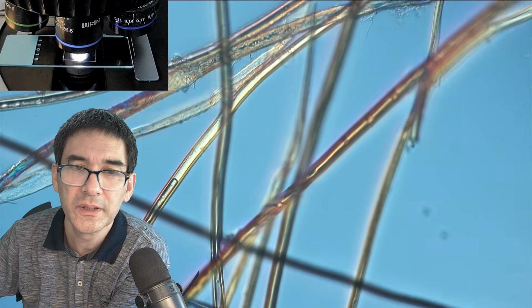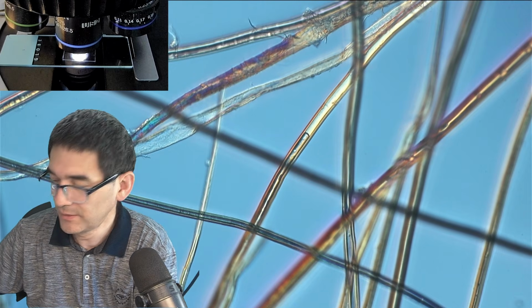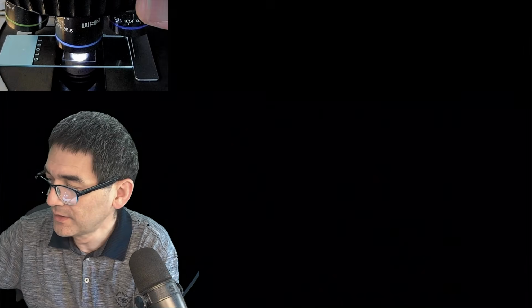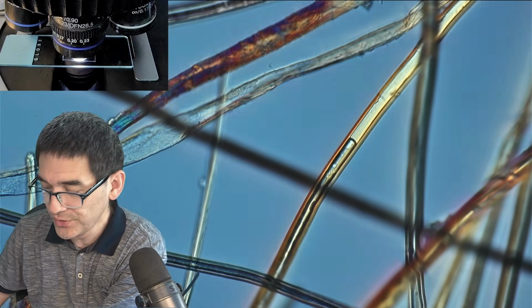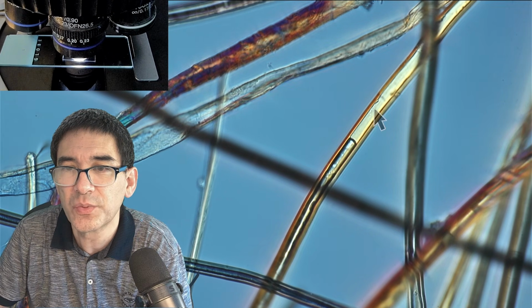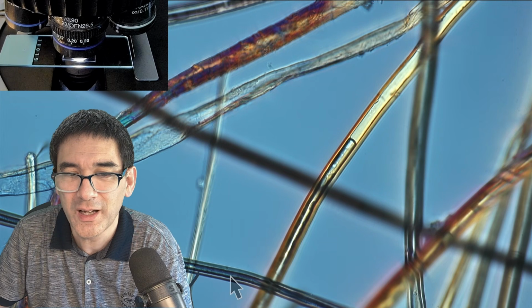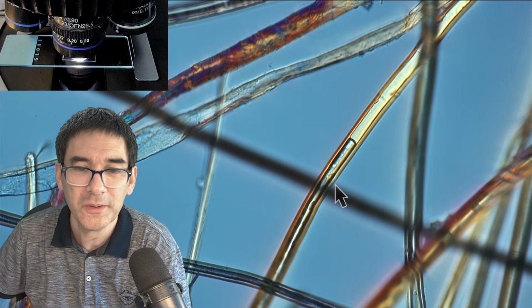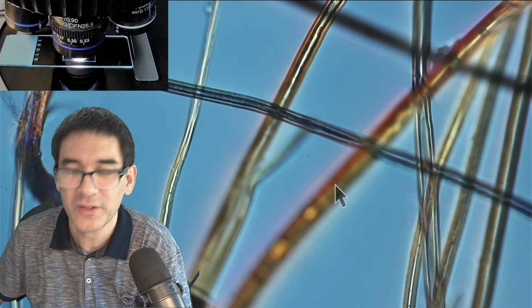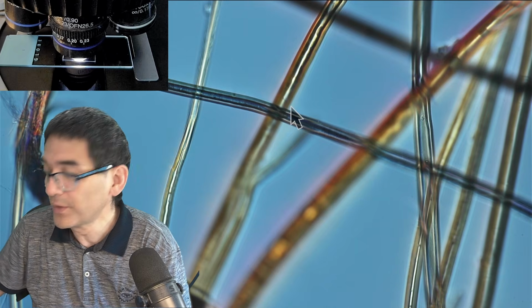Almost looks a little bit like it's hollow. Very nice. Look what we're able to find here. It is actually hollow. I just want to show this to you. You can see over here that this is filled with air, and this one now seems to be filled with water, which shows that those things seem to be almost like a little tube on the inside. And here you can also see it a little bit. Just wanted to share that with you as well.